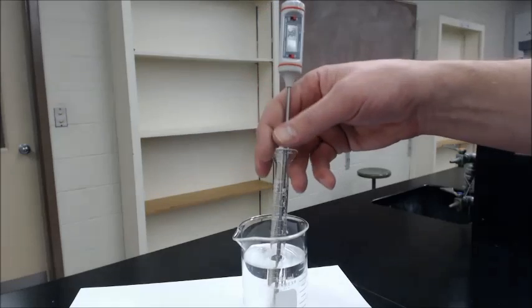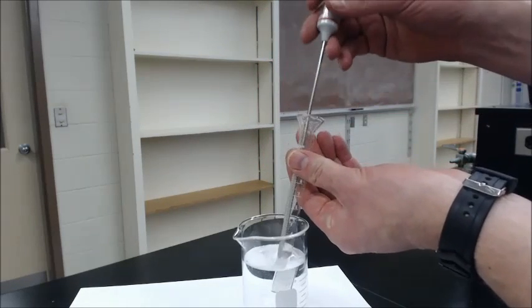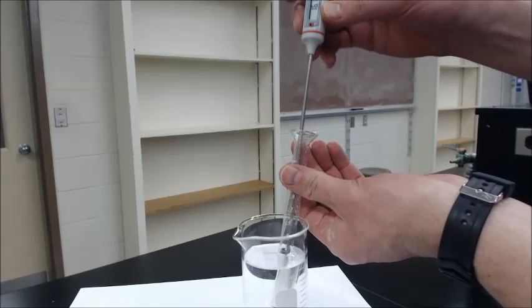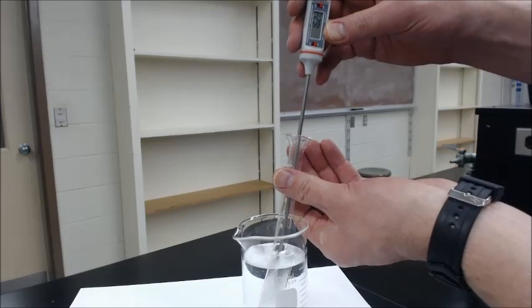So lots of mixing. And they should see that the urea will probably start to dissolve a little bit more. But they've got to get that solution back up. They've got to get it back up to 25 degrees.